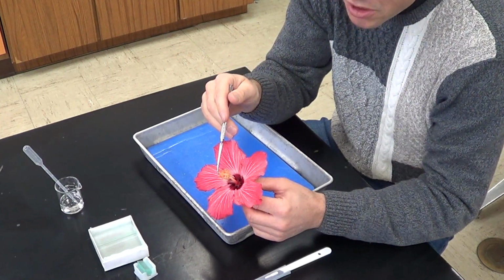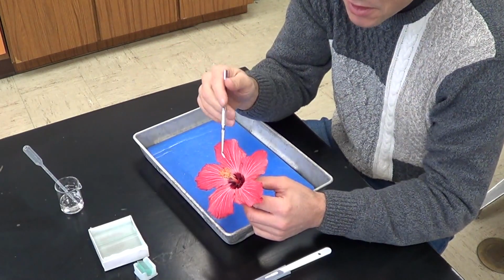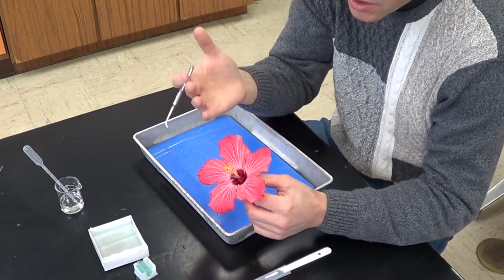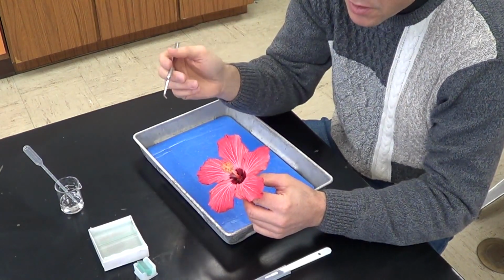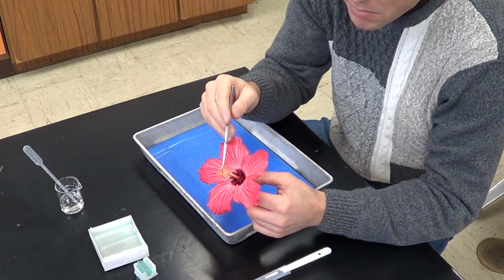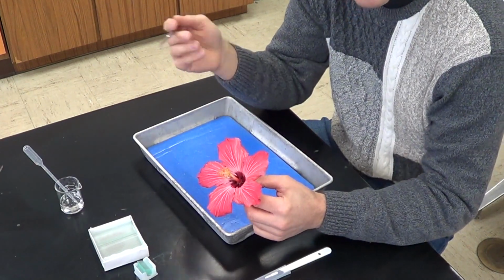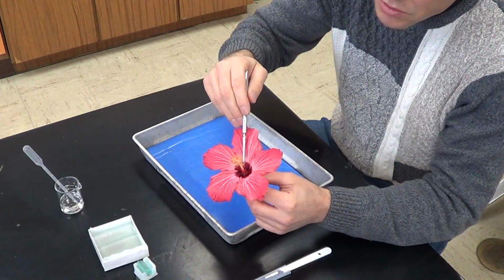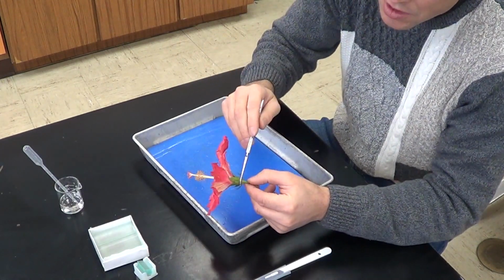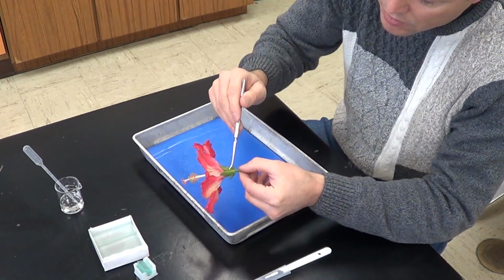The top part is going to be the stigma. And I like to call it the sticky stigma because it tends to stick or attract pollen grains on its surface. Now the stigma is going to be connected right here to a long pipe-like structure called a style. The style goes all the way down to the center of the flower, right down here, this large dilated area right here.